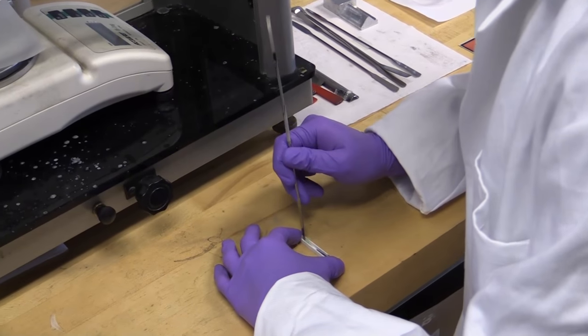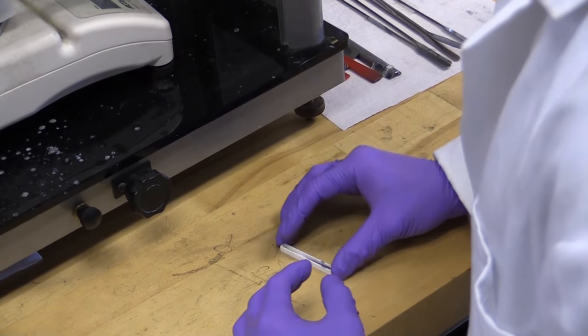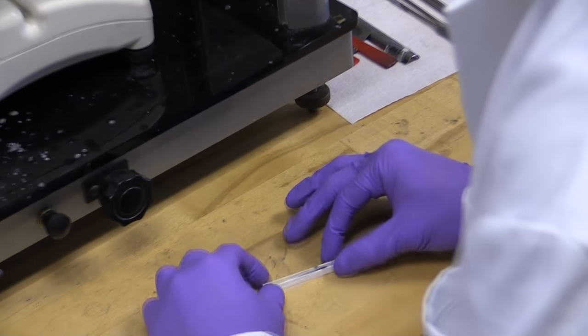It's important that we spread out the source to help it sublimate more uniformly and not stop halfway through. Here we are.